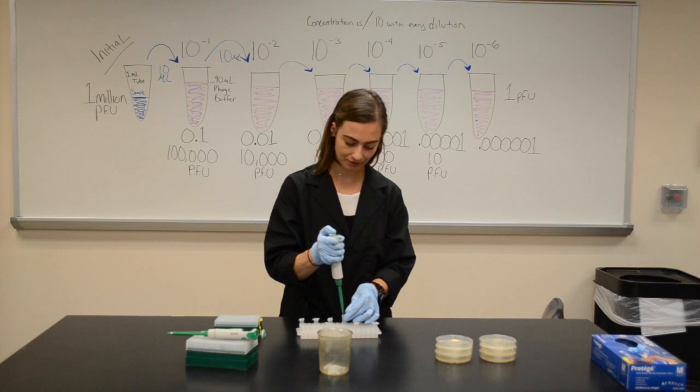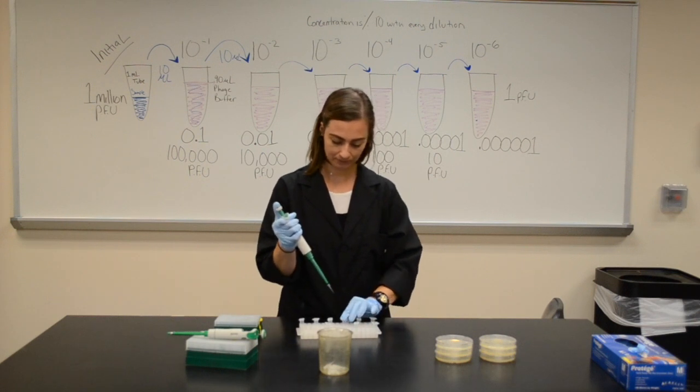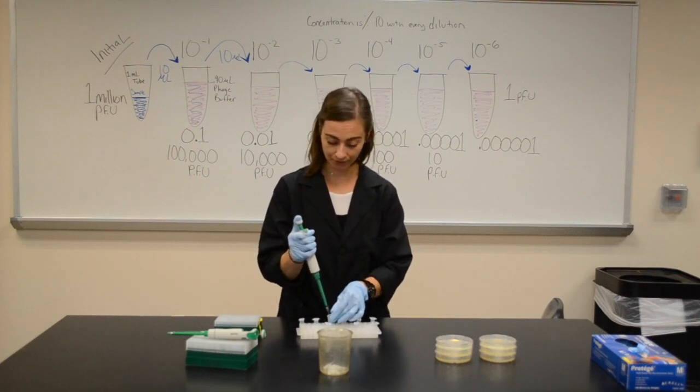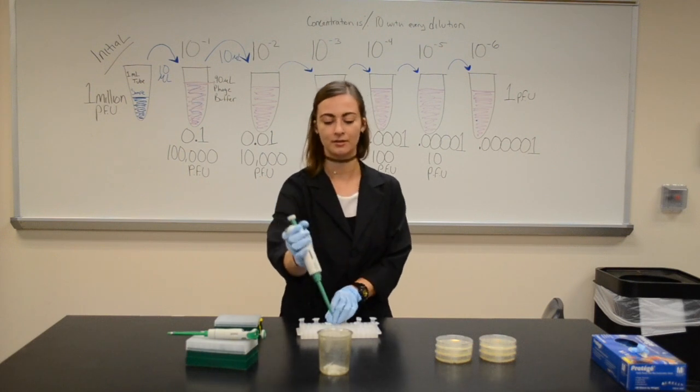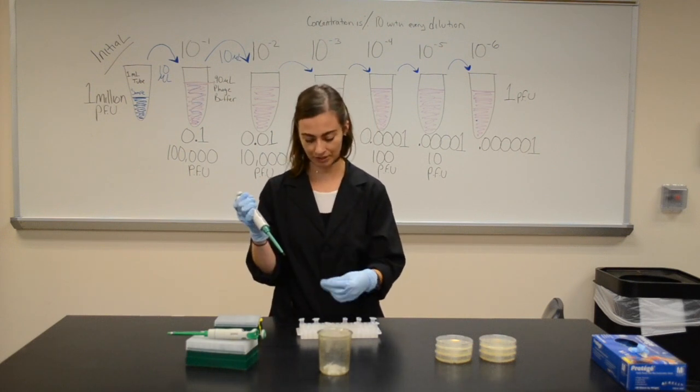Move from 10 to the minus 3rd into 10 to the minus 4th, dividing it again by 10. Give it a little shake.